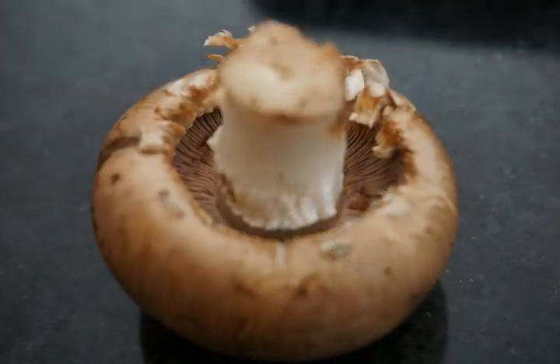You'll need to flip your mushroom over to see the gills. You might need to remove the tissue that's covering the gills — that's called the veil. Do it a little more gently than I did, because I broke a little portion of my mushroom's cap.